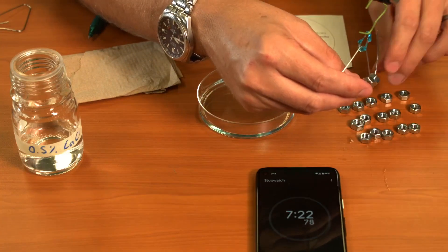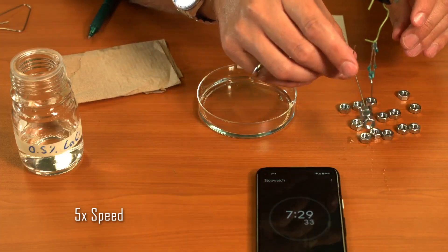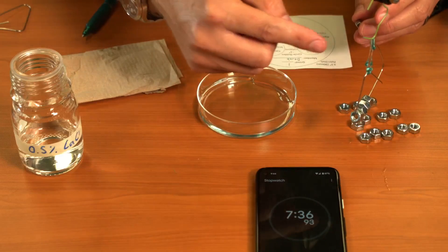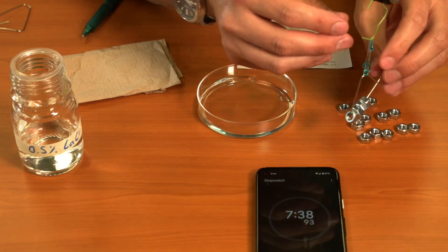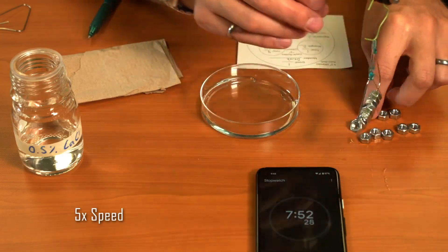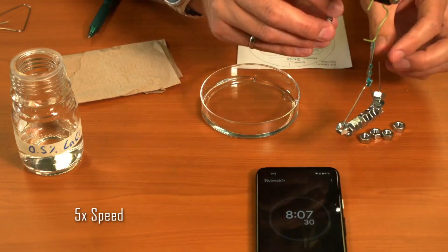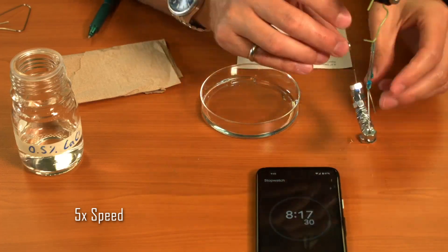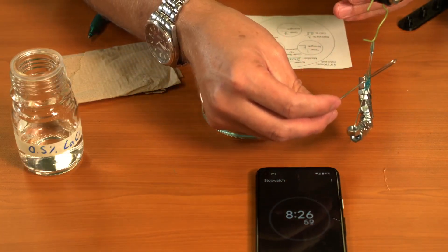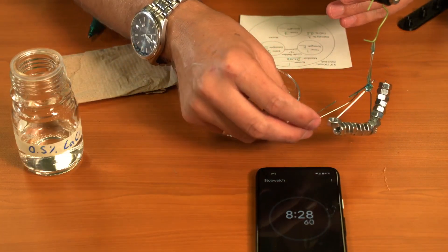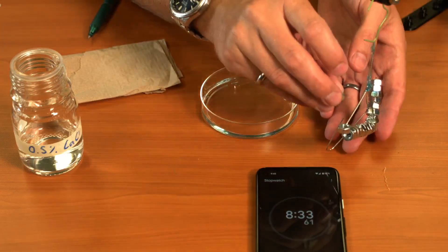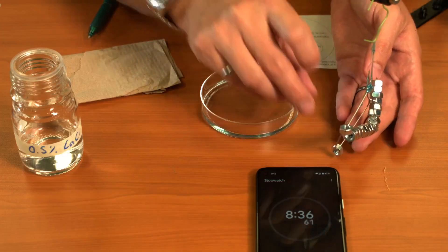We'll start loading. I'm just going to go ahead and load a couple of them on here because I'm pretty sure those will hold at least a few. Notice that this is not perfect because there's quite a bit of blobs there. Let's see if we can get our second paperclip on there. I do want that second one to hang down below the first one a little bit so that way I have room to put on the weights.